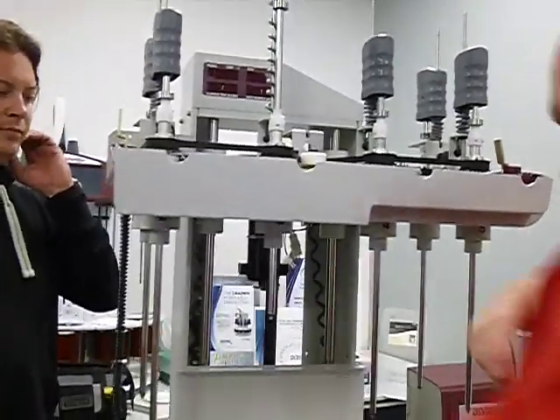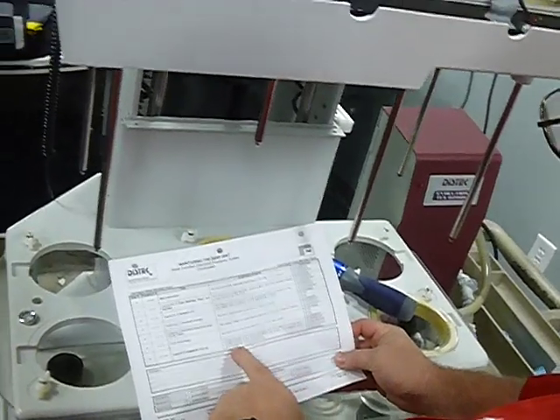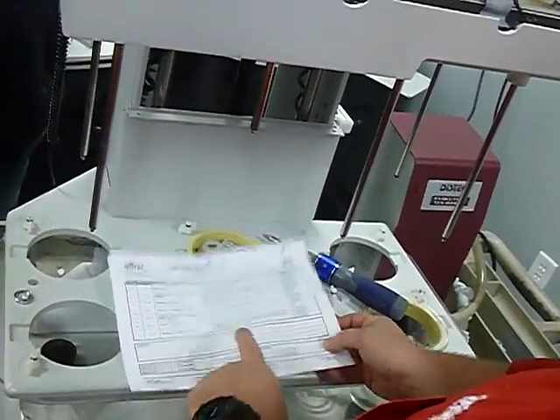And it actually even says right here in the document, the gap between the drive motor and gear magnetic pickup must be appropriate. If the observed RPM is not erratic, the magnetic pickup is considered to be satisfactory. So if it's running like it's supposed to, that magnetic pickup is considered to be running fine.